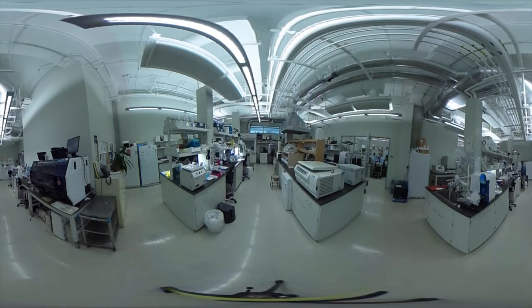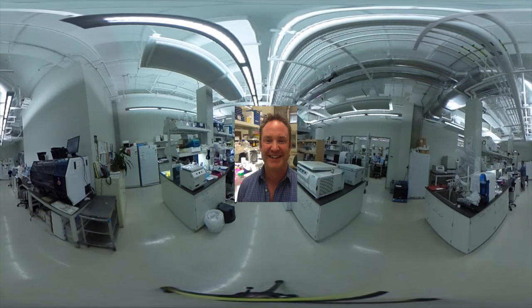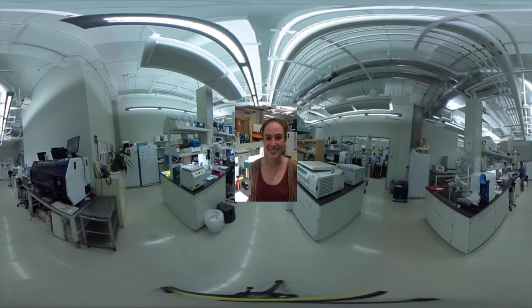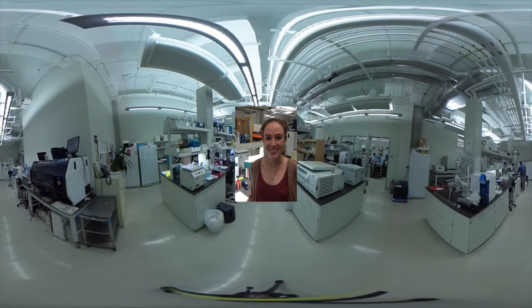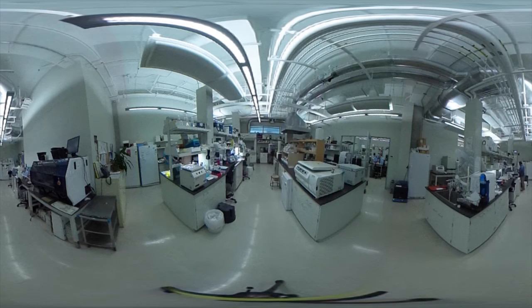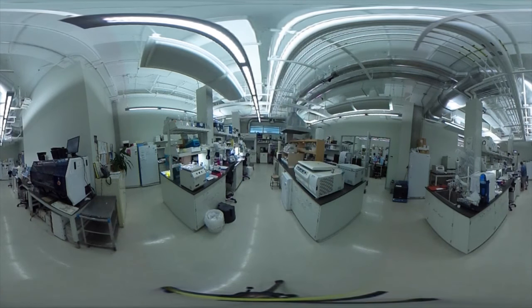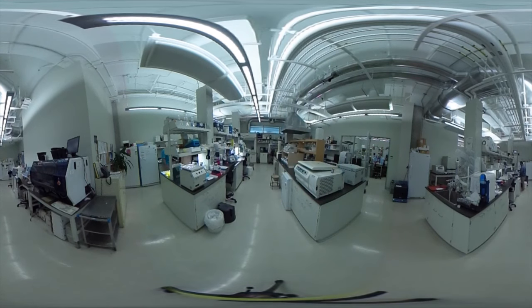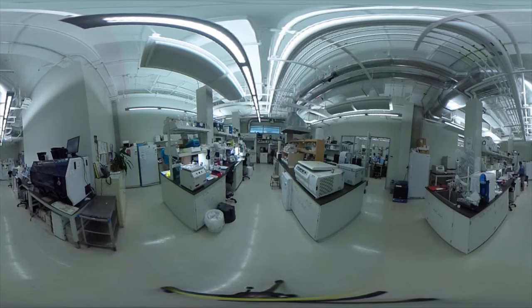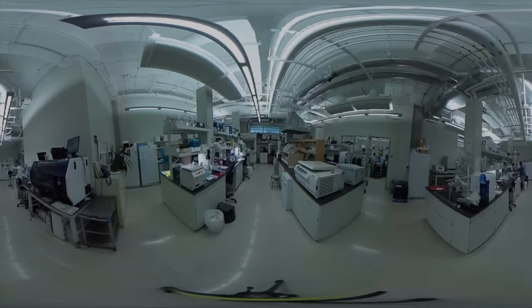Your guides: my name is Troy Lock and I am one of the research technicians within the Molecular Biology Service Unit. My name is Chandra McAllister and I'm a postdoctoral fellow in Dr. Janice Cook's lab at the University of Alberta. One other thing before we begin: if you're watching on a phone or tablet, you can pan around by simply moving your mobile device. Let's begin the tour.